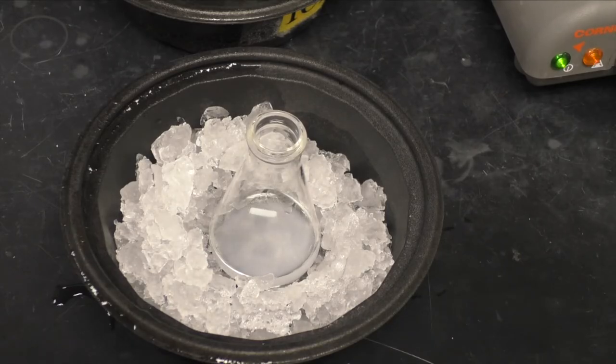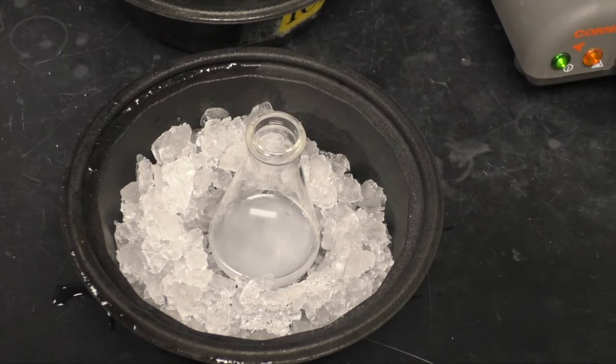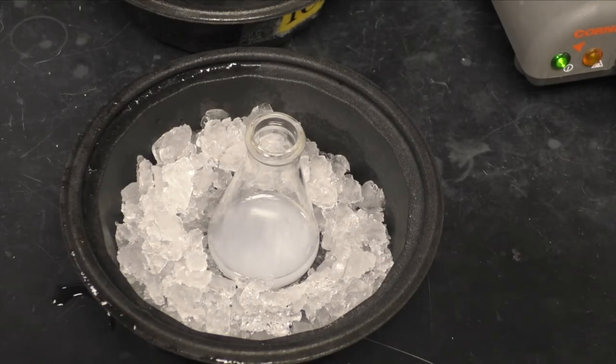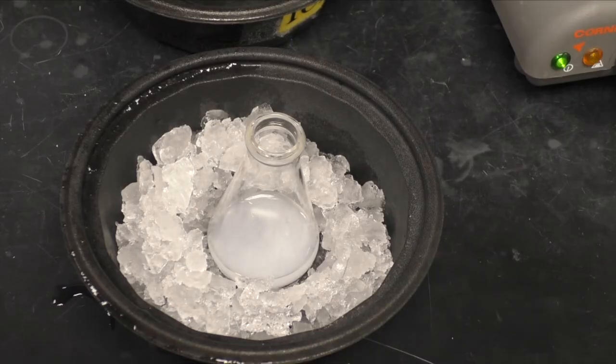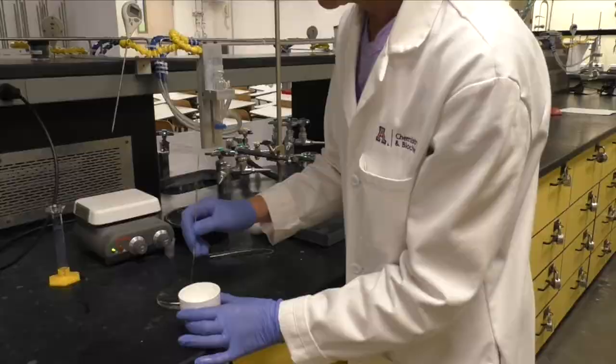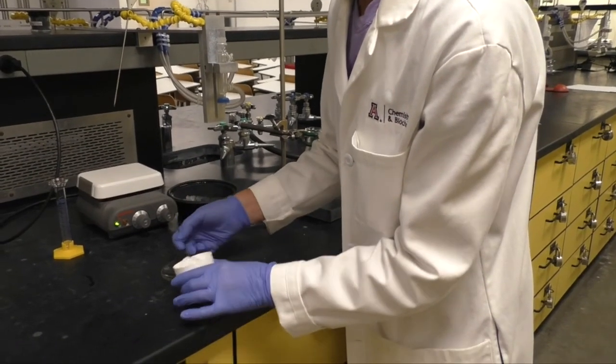Once formation of crystals appears to have ceased, this can be anywhere from 5 to 15 minutes or more, collect the product using suction filtration. Again, allow the vacuum to run for about 5 minutes to completely dry the final product.